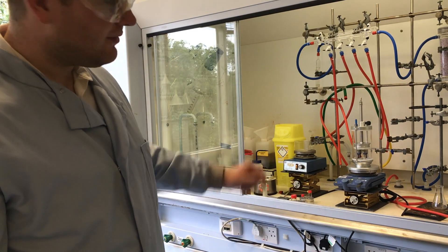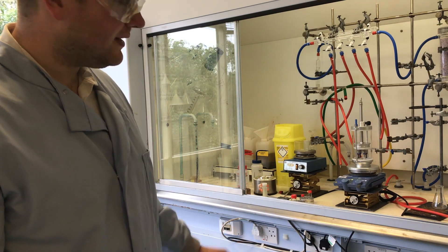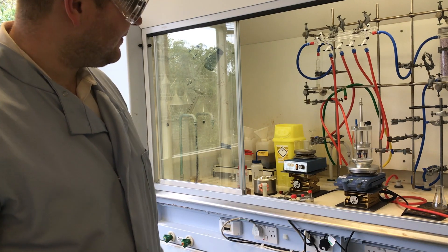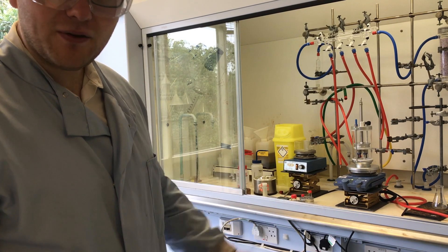So at this stage, everything's good and ready to go. All we need to do is apply some vacuum to get some air flowing through the sample.